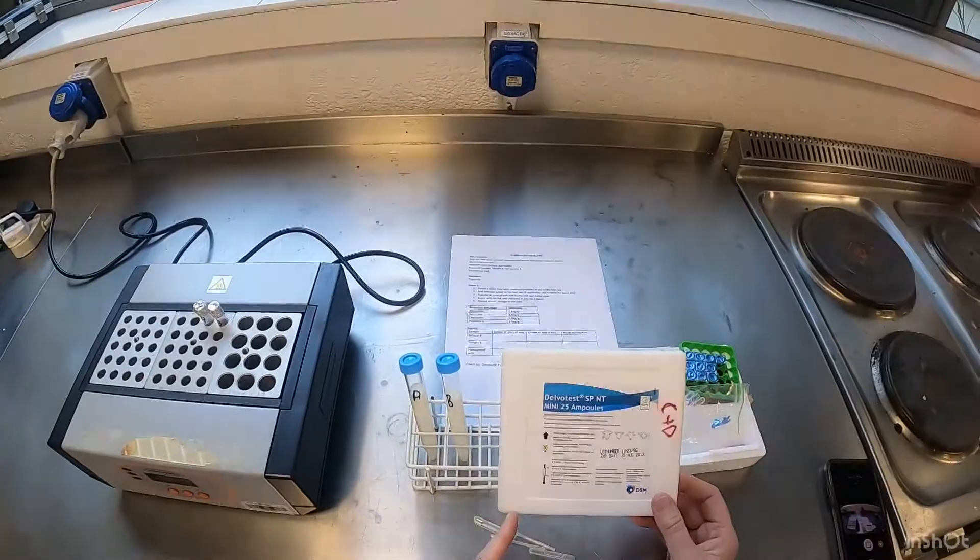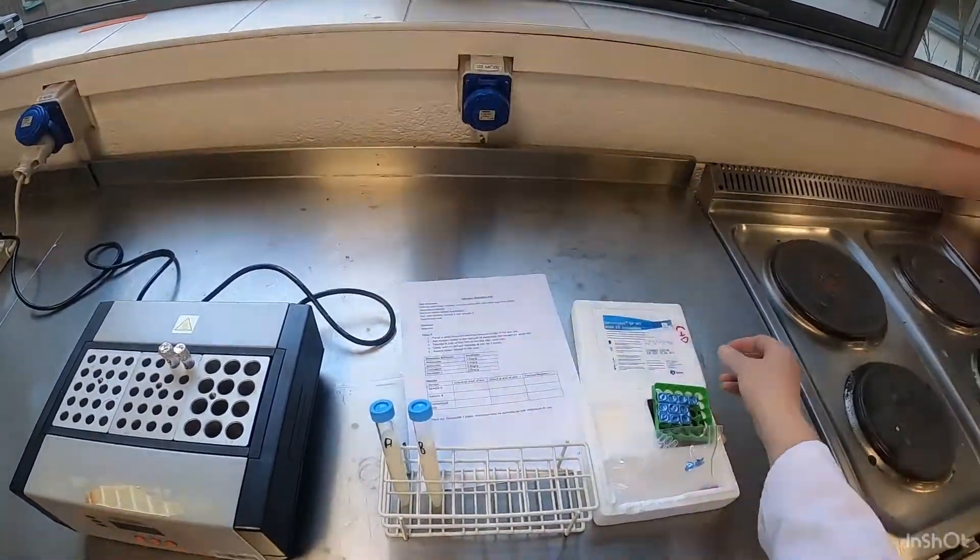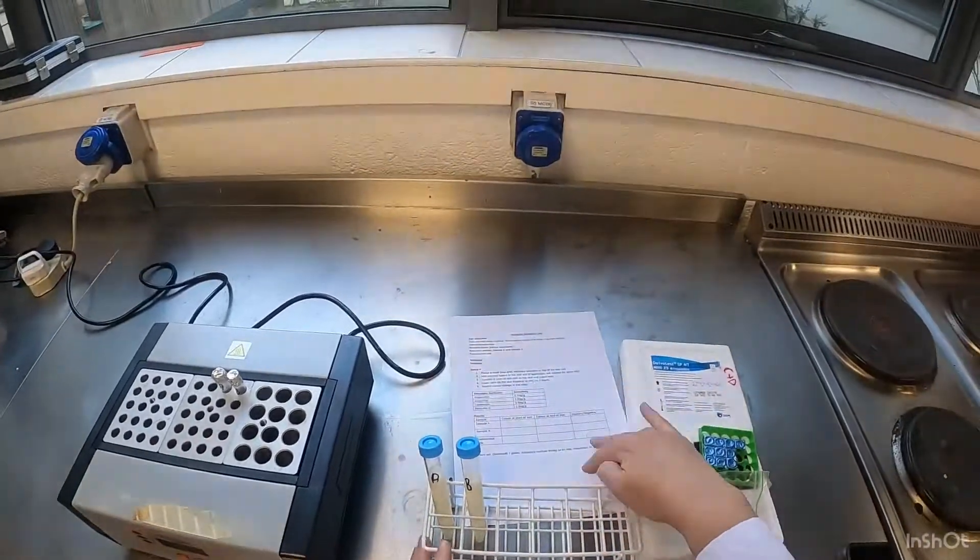The great thing about this is that you could do this at home on your own farm if you weren't too sure whether there was antibiotics in your milk or not.